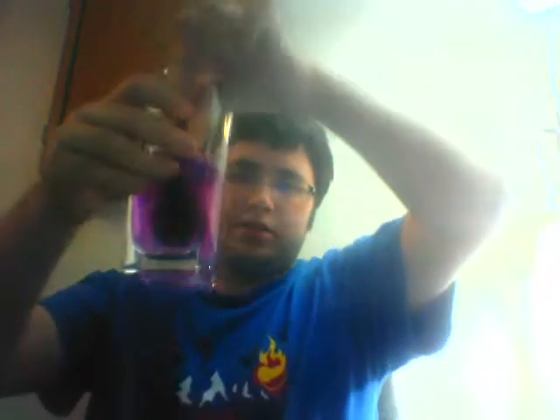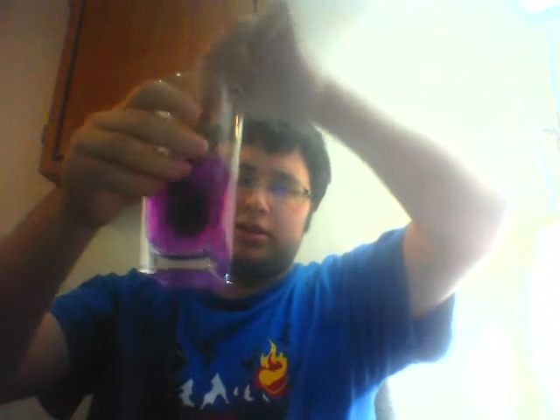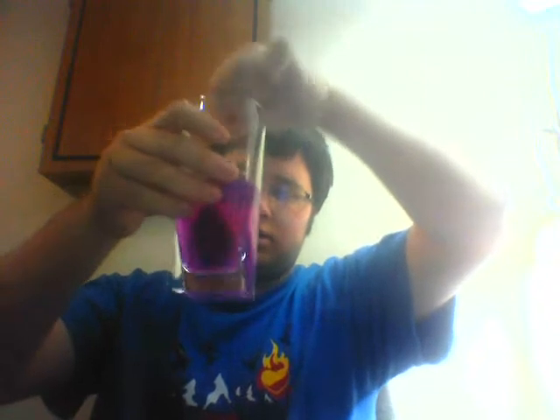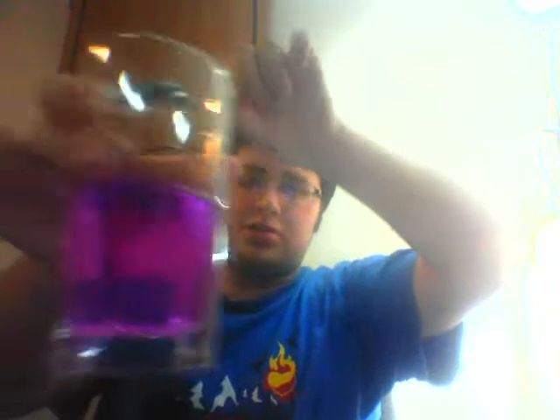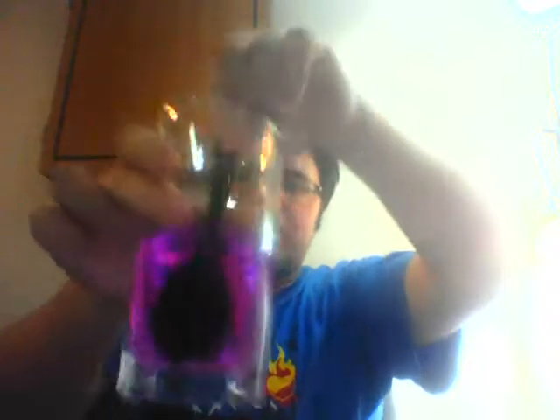That makes sense. So I'm using my high-tech plastic spoon. I'm getting just a little bit of sodium carbonate. It's less than a spoonful. I'm going to take it and I'm going to dissolve it in the solution. You can see it turns the sort of pink magenta color that we saw earlier with the water into wine demonstration.